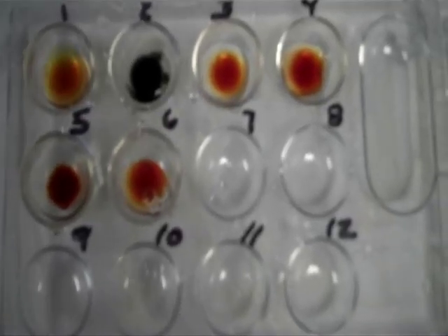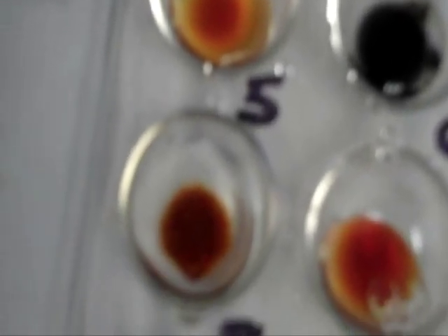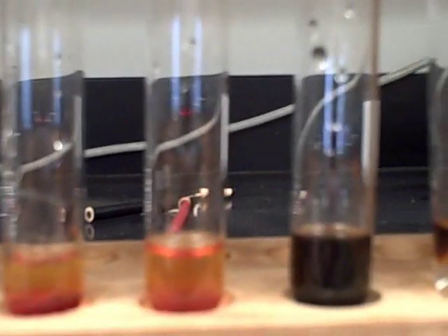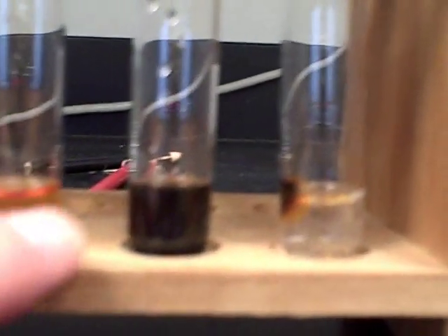Now let's analyze the results. We're looking for a blue-black color. Starting with water — did our water turn black? That's the first one. The second one is our cornstarch. Then sucrose, then glucose, then the saltine cracker, then egg white.